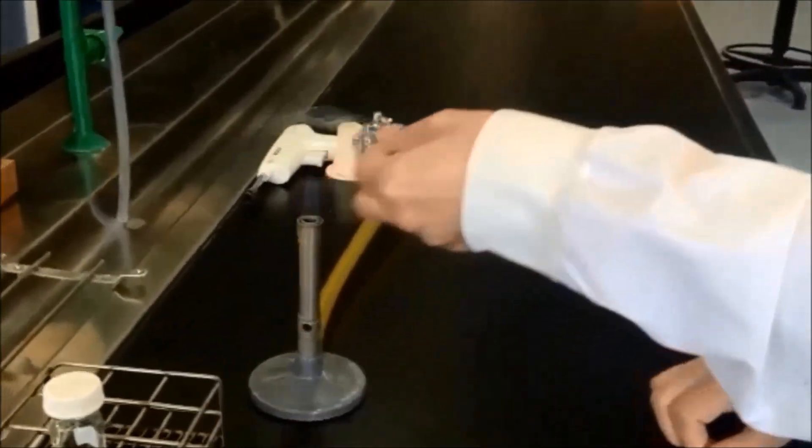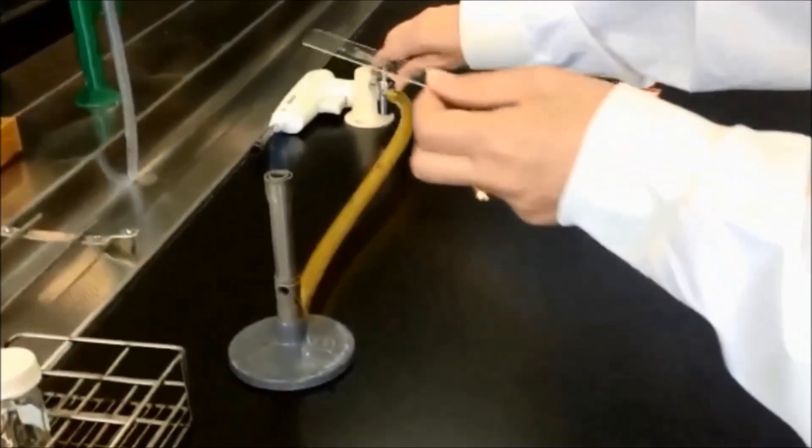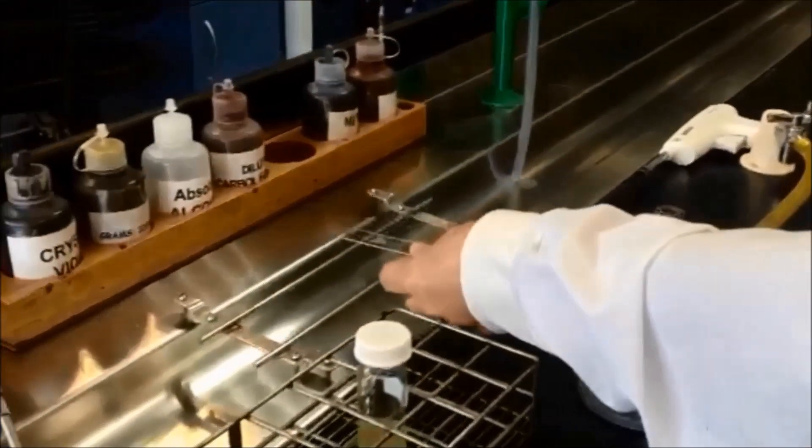Our demonstrator isn't wearing gloves as they can catch alight. The broth culture is now ready to be Gram stained.